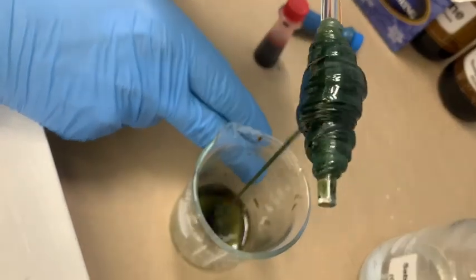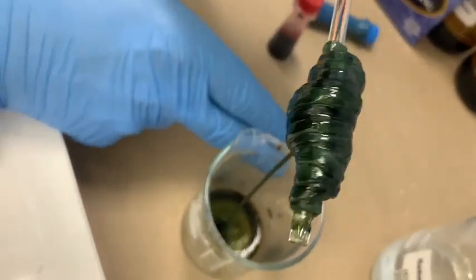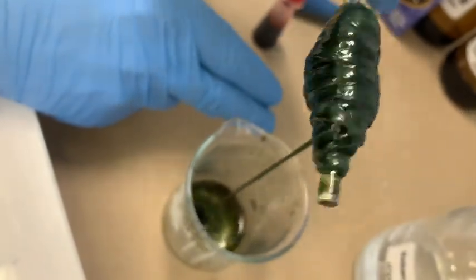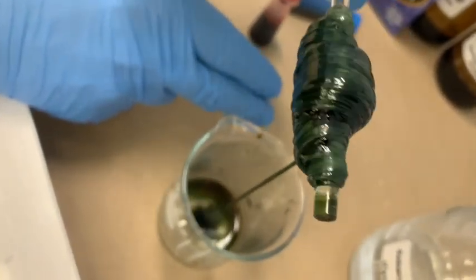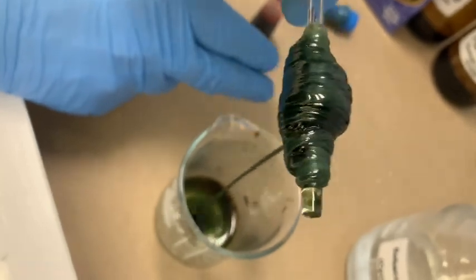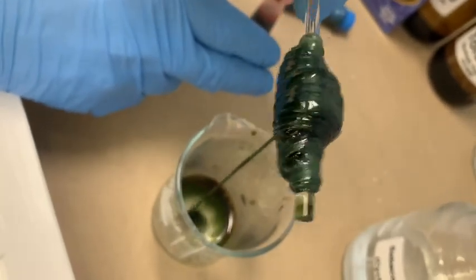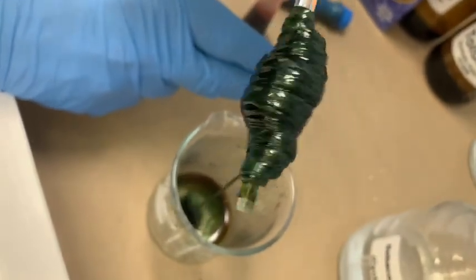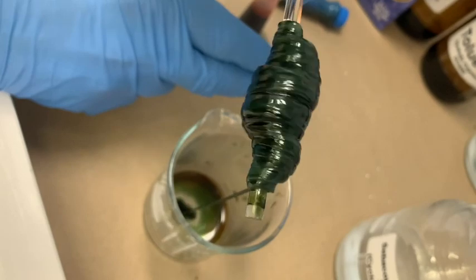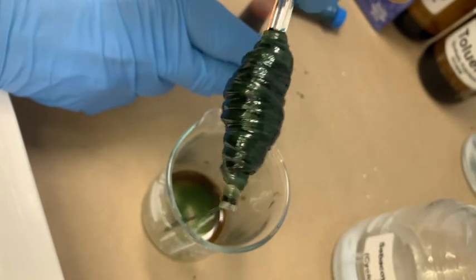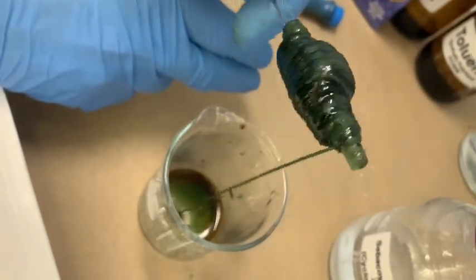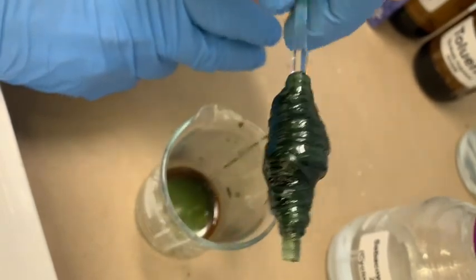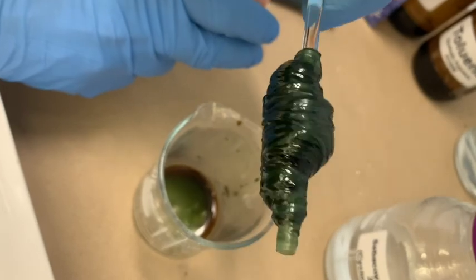And it is going to be totally gruesome. But it's still pretty cool. It's kind of shiny. It's almost like taffy. I'm going to kind of look at that forming. Very weird structure there. Good texture. And that's how nylon is made. Imagine that they were pretty surprised when they figured it out.